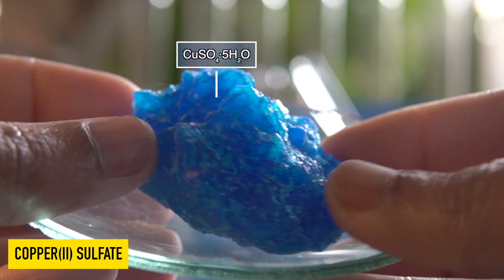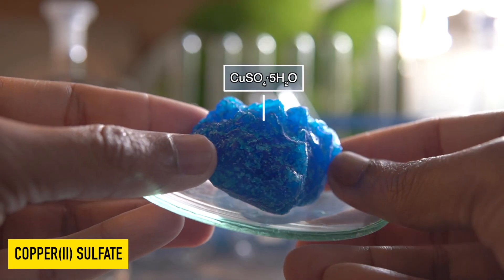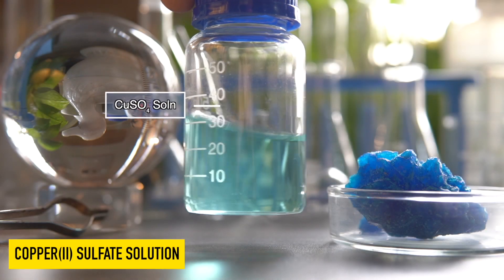This is hydrated copper sulfate crystal. This crystal can dissolve in water very easily to make a homogeneous clear solution.